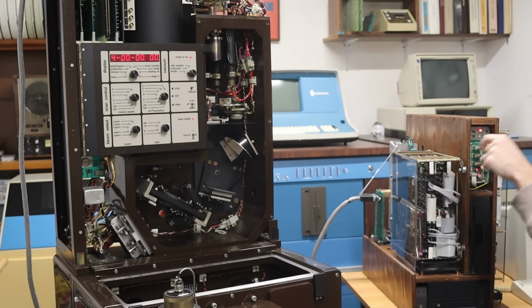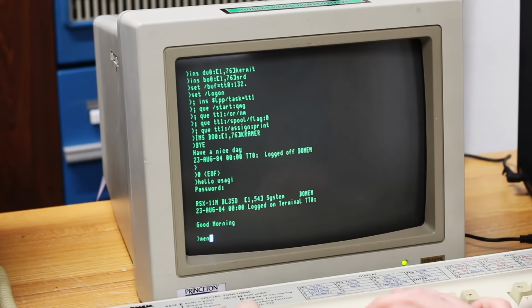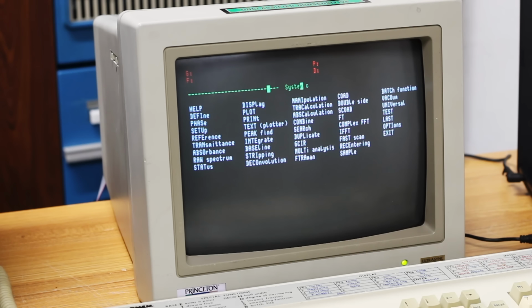This is the first time I've had that Bomem DA-3 hooked up to this PDP-1173. I have no idea if anything is gonna work at all. I don't know, we'll give it a shot. So I'll go ahead and type menu here at the prompt in the 1173. It's gonna boot up the Bomem DA-3 Spectrophotometer software.